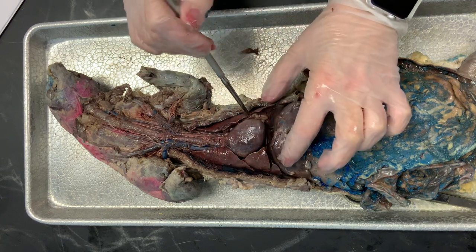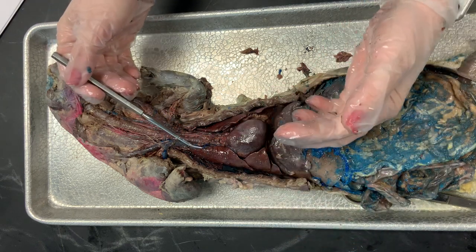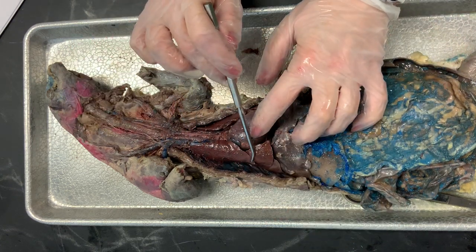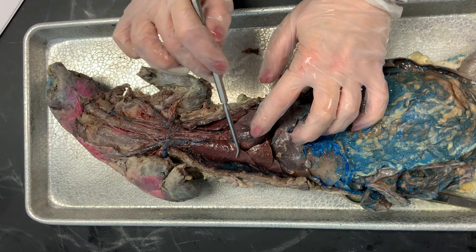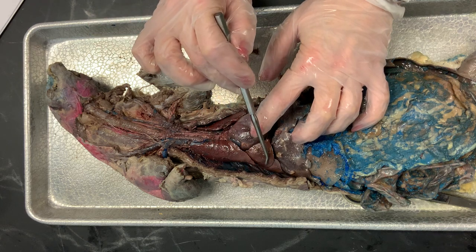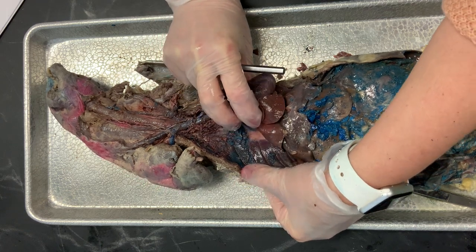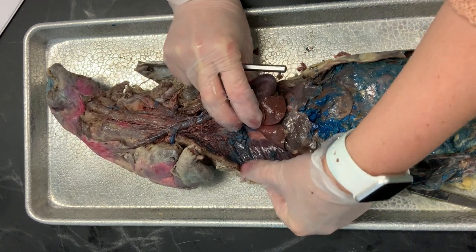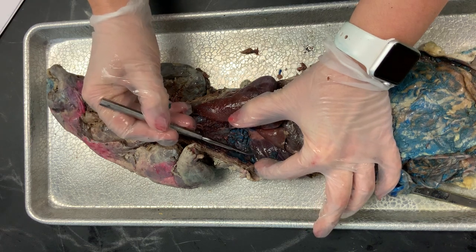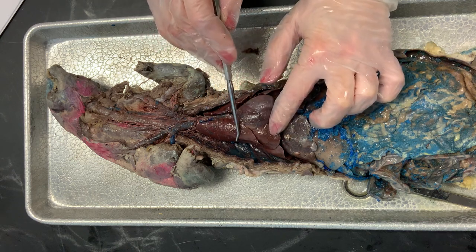Surrounding the lungs is the pleura — a membrane that covers the lungs and lines the thoracic cavity. You can see the lungs here are quite shiny. This shiny membrane on the surface of the lungs is called the visceral pleura; it covers each lobe. The wall of the cavity — I've cut away the ribs so we can see better — the deep portion of the ribs there is shiny as well. That is lined by the parietal pleura. So the wall is lined by parietal pleura, and the lungs themselves are covered in visceral pleura.